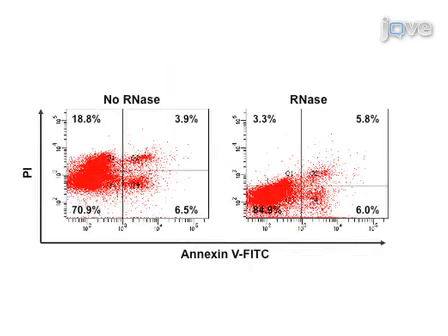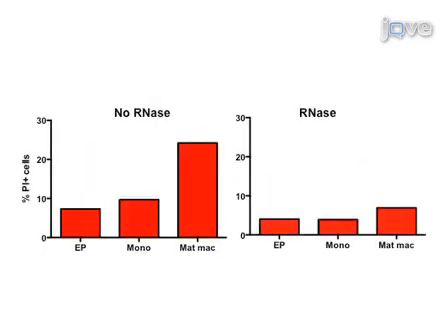These scatter plots of primary goldfish kidney macrophages show a significant reduction of false apoptotic necrotic events in cells prepared with the Modified Annexin PI protocol. The new protocol shows that 84.9% of cells are viable. Gates were drawn based on parallel ImageStream samples that assess fluorescent and morphological features. In one example, early progenitors, monocytes, and mature macrophages were stained by the Modified Annexin V PI protocol described in this video, or by the conventional method for this figure.